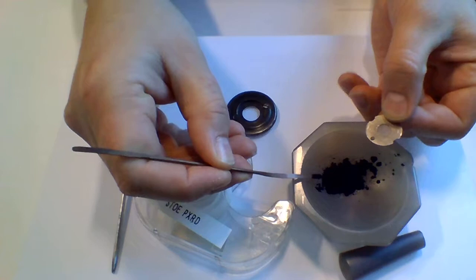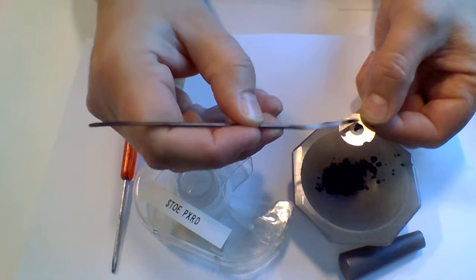Take a little bit of your powder, just a little bit, and spread it over the surface.